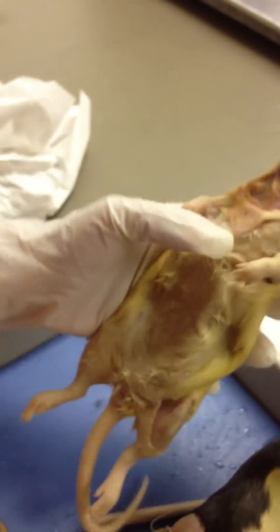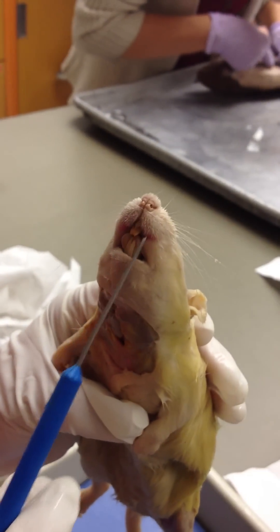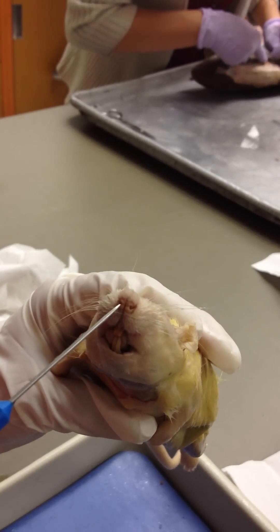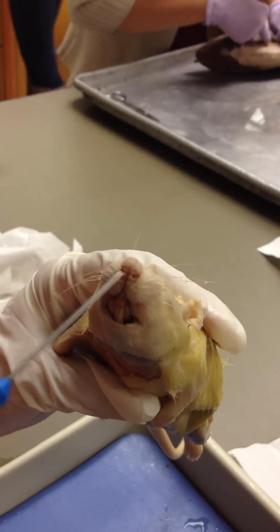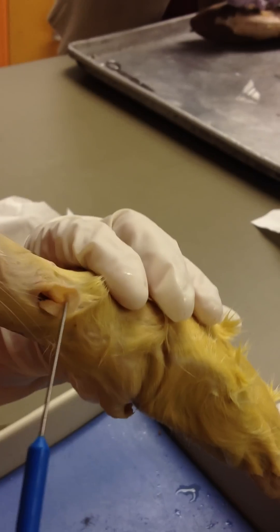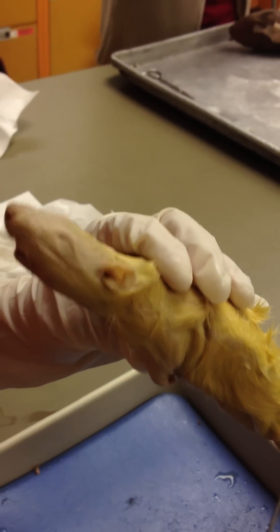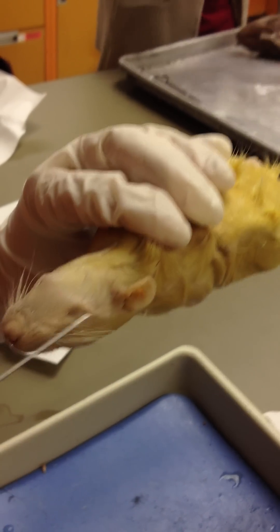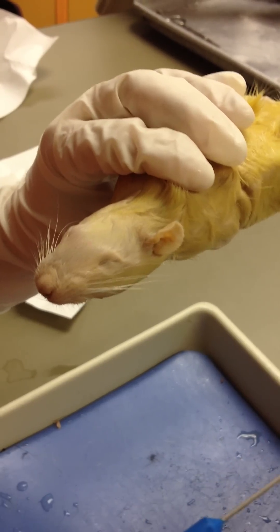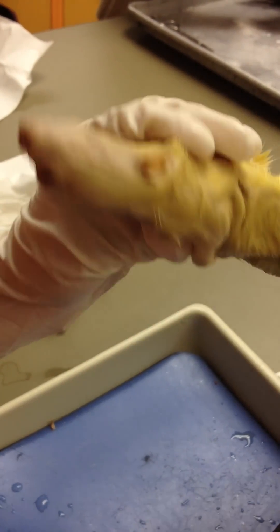In the upper lip, this slit is your philtrum. Here are your nares, and then these external ears are the pinna. The whiskers are called vibrissae — read it in your lab manual.